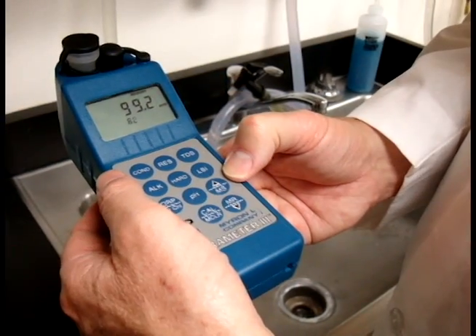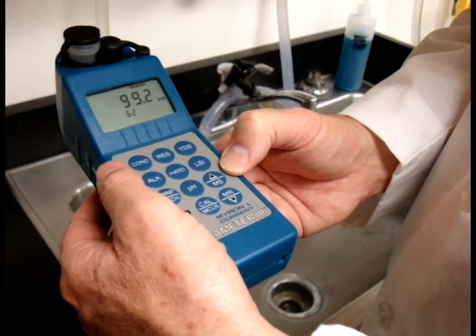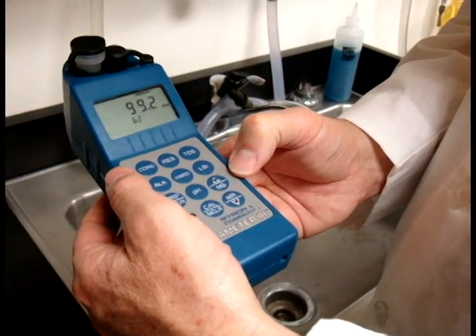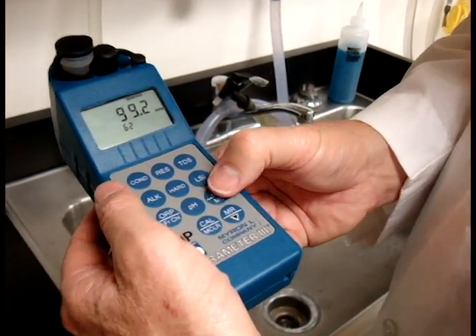If you're doing an LSI reading later, you'll need to store your alkalinity reading. To do that, you'll just hit the MS key right here.